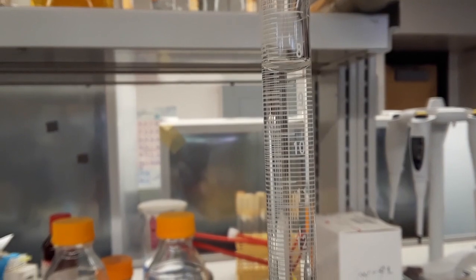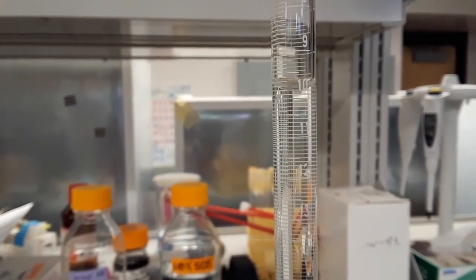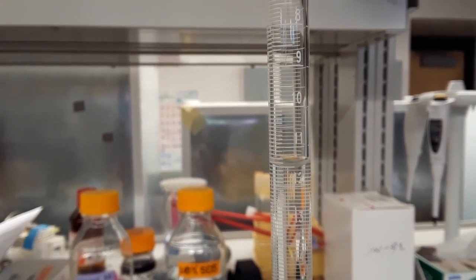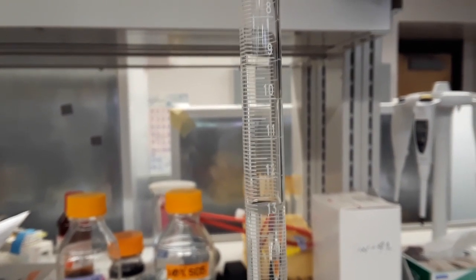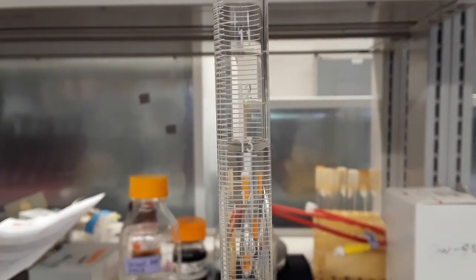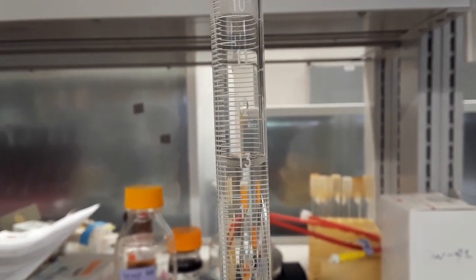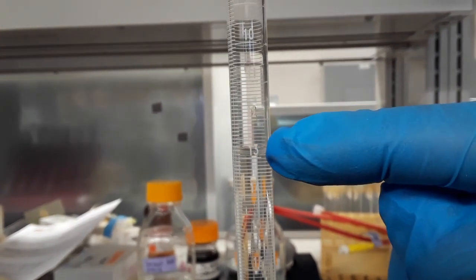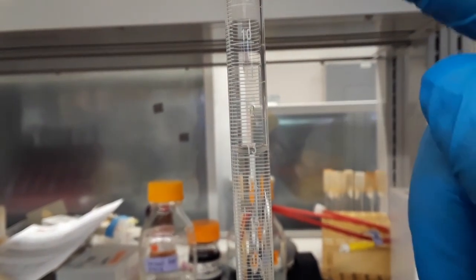And you can see how the volume of water is just dropping the longer I leave the stopcock turned. And then when I turn the stopcock to close it, you can see the meniscus right here on the glass burette. And we can calculate the end point and subtract it from our starting point.